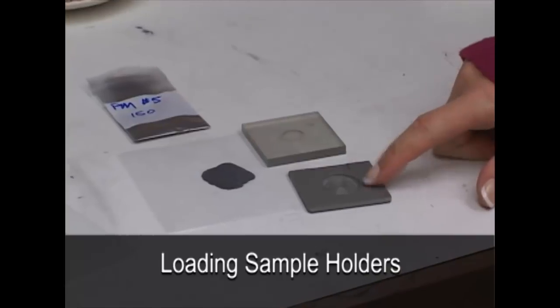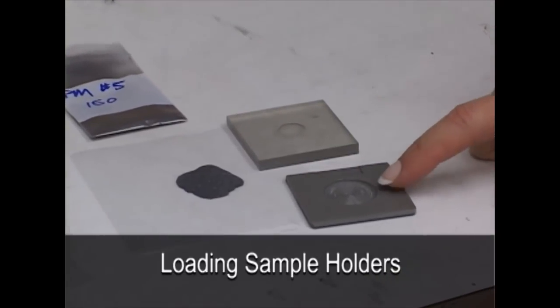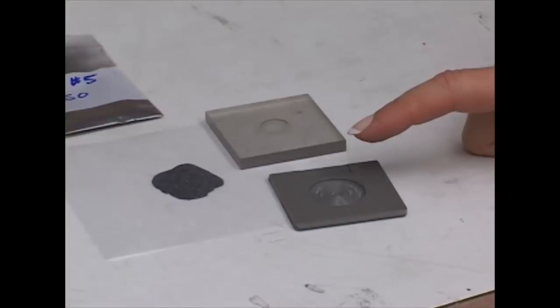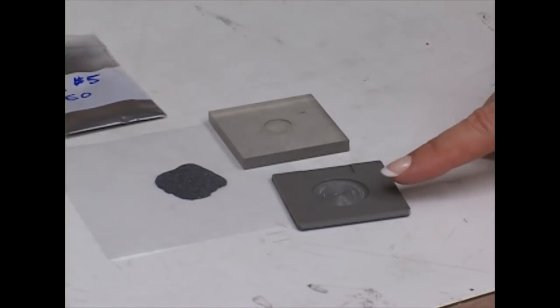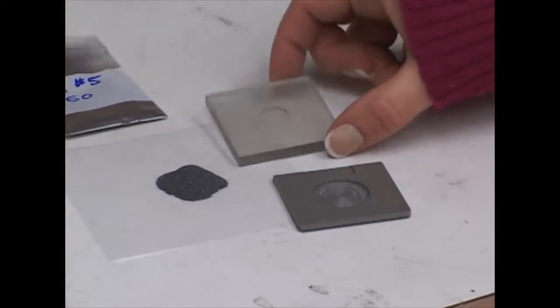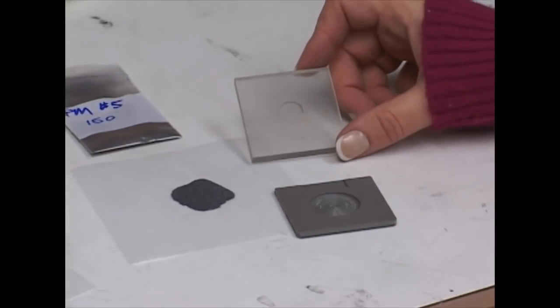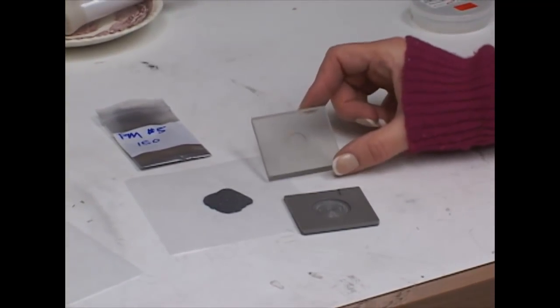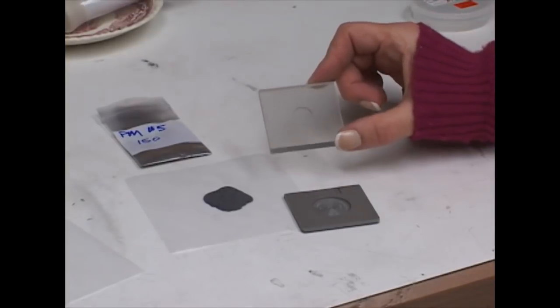There are two sizes of sample holders here. This is preferred, this large well here, because the more particles that you have represented on the surface in all of the various crystal planes, the better your data is going to be. But often most people don't have this much material and this will work if your material has been prepared correctly. It is just really important to make sure you have a very fine powder.